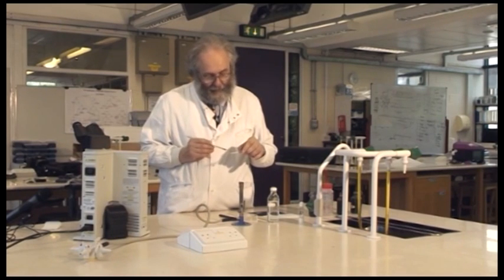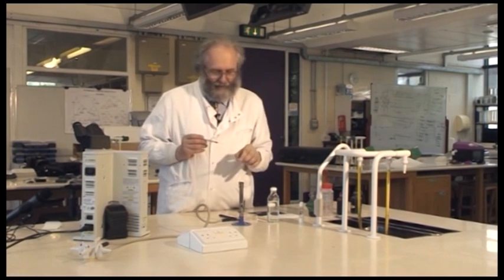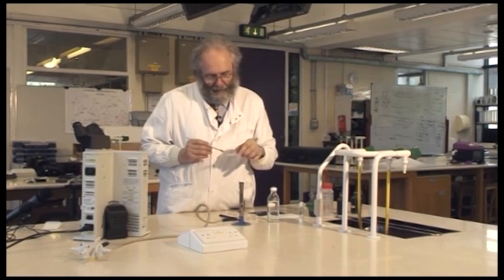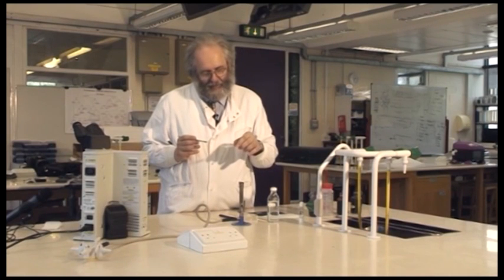So I'm afraid this is terribly boring and what you really want is a potter's wheel or a kitten playing with a ball of string. Short of that, you'll have to do with me waiting for the bacteria to dry.